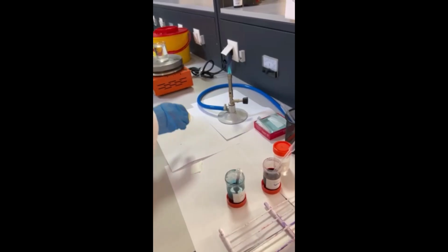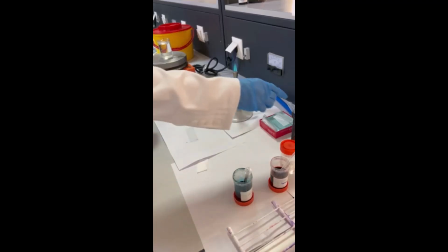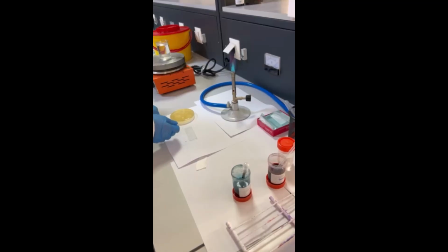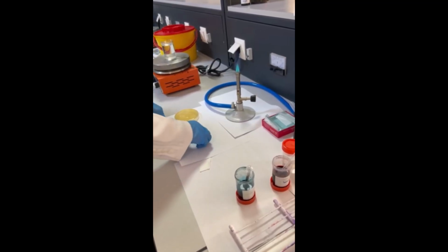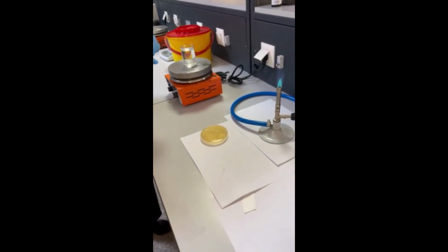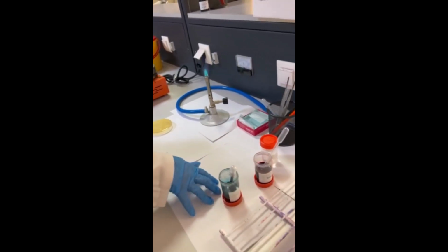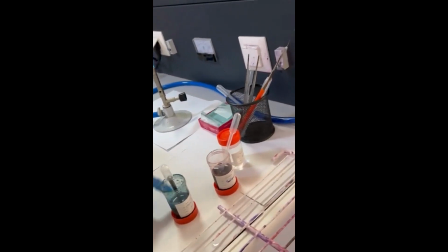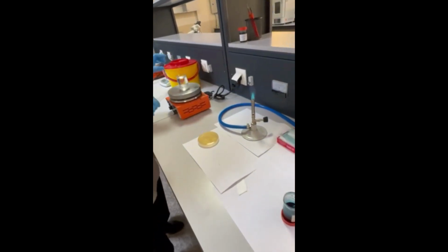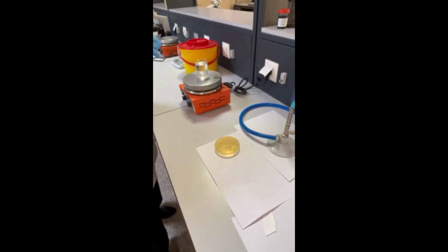Then the first step is to make the smear of the bacteria. You know how to make the smear: a drop of distilled water, then touch a colony, mix, and spread on a clean slide, allow it to air dry, then fixation. Now the procedure of the spore stain requires two reagents: the primary stain and counterstain, malachite green and safranin. And we need the steam heat because it allows the primary stain to enter inside the spore.